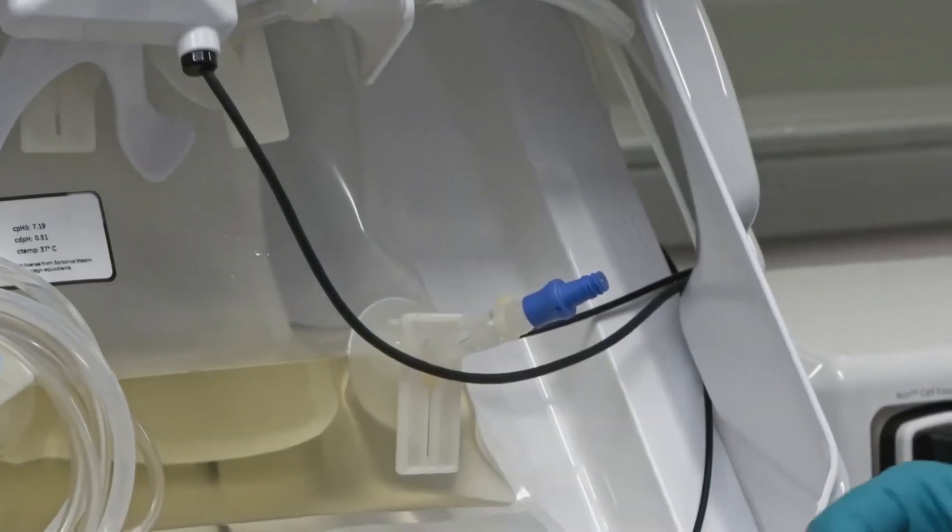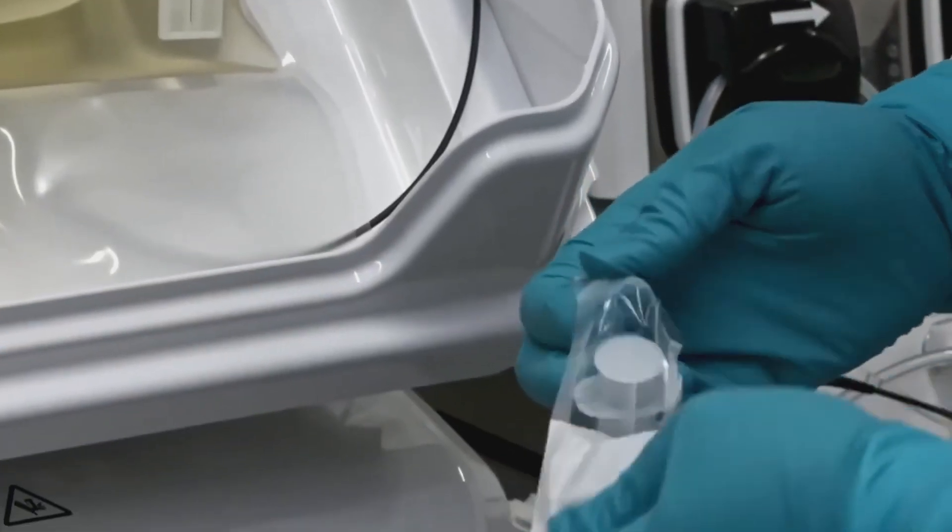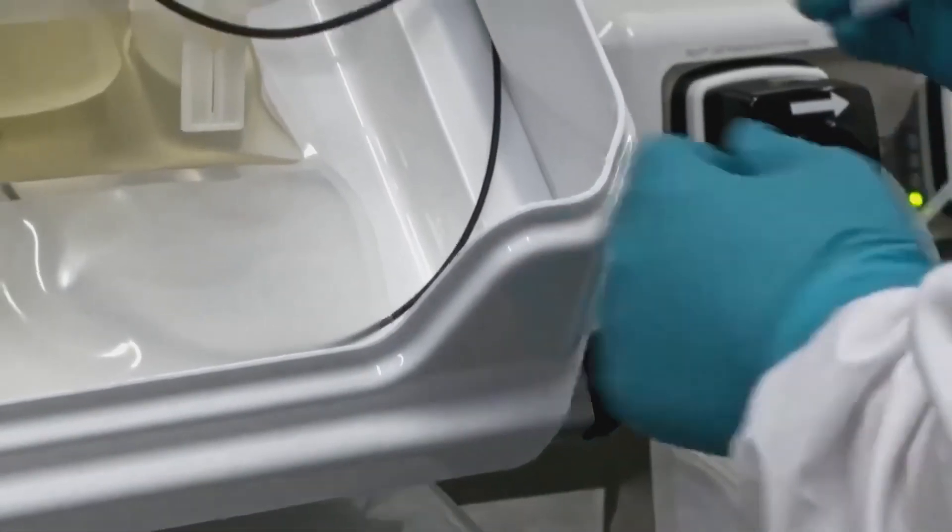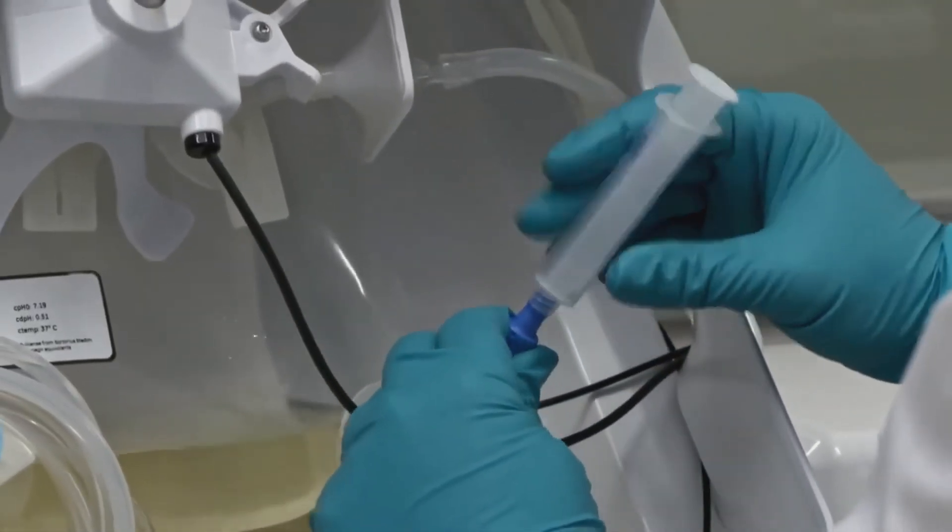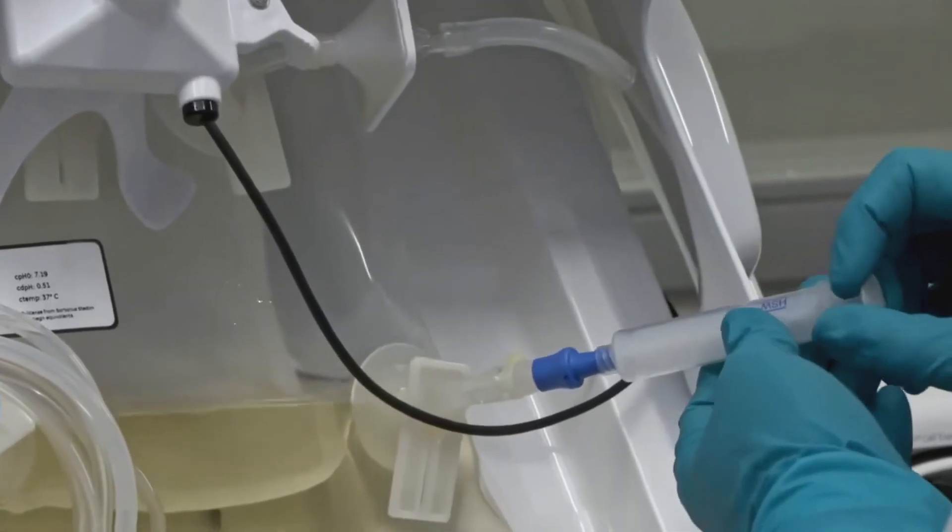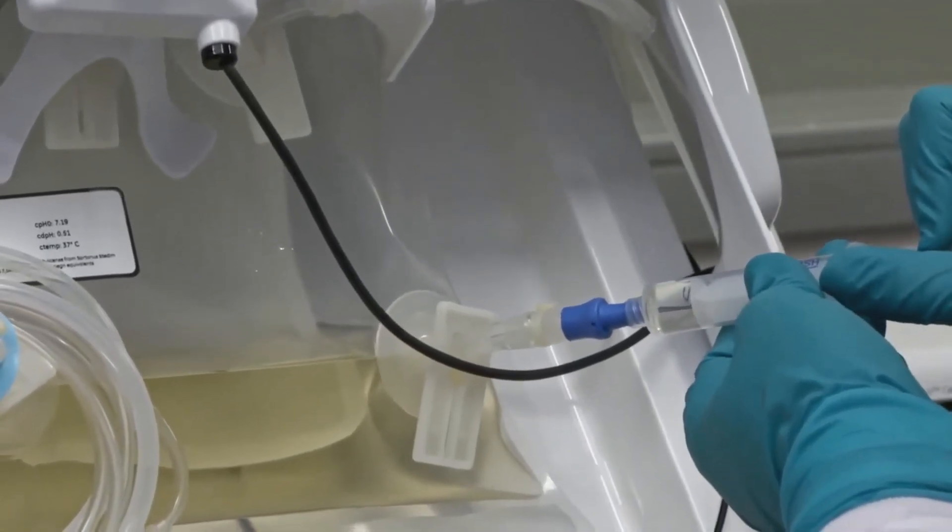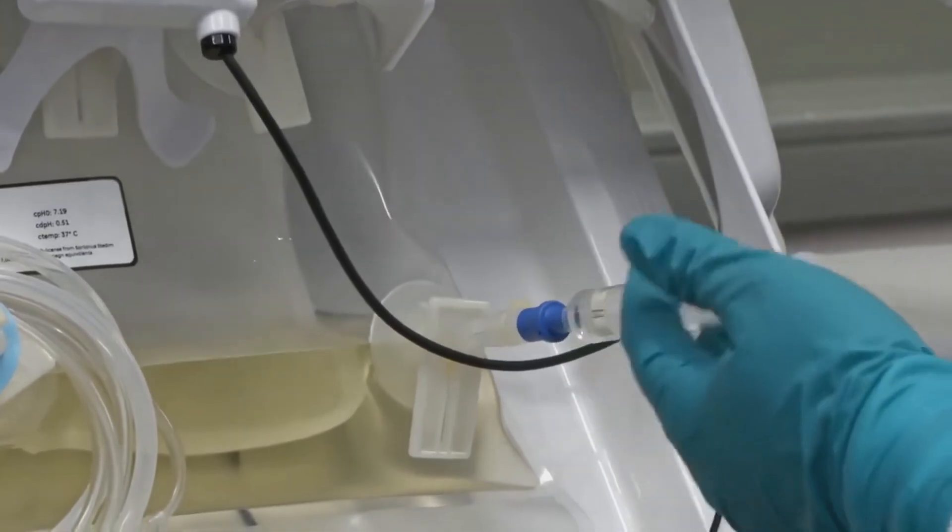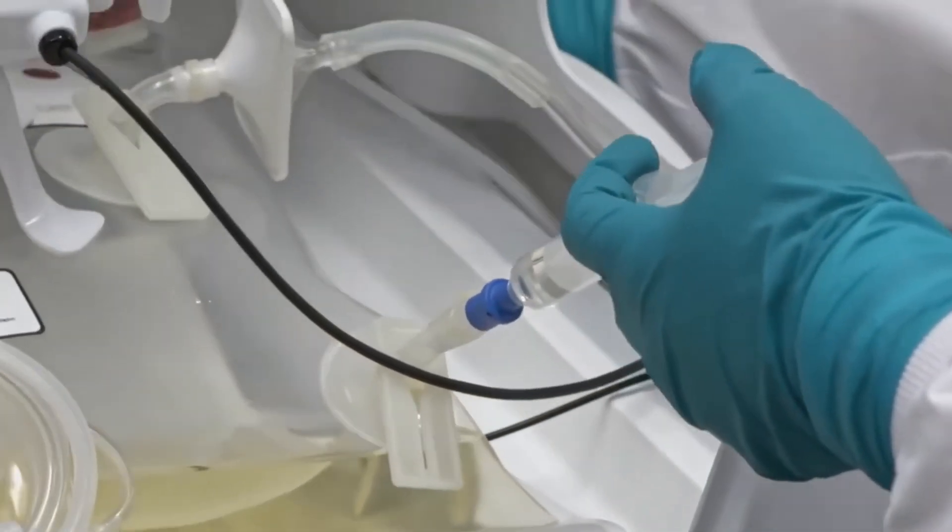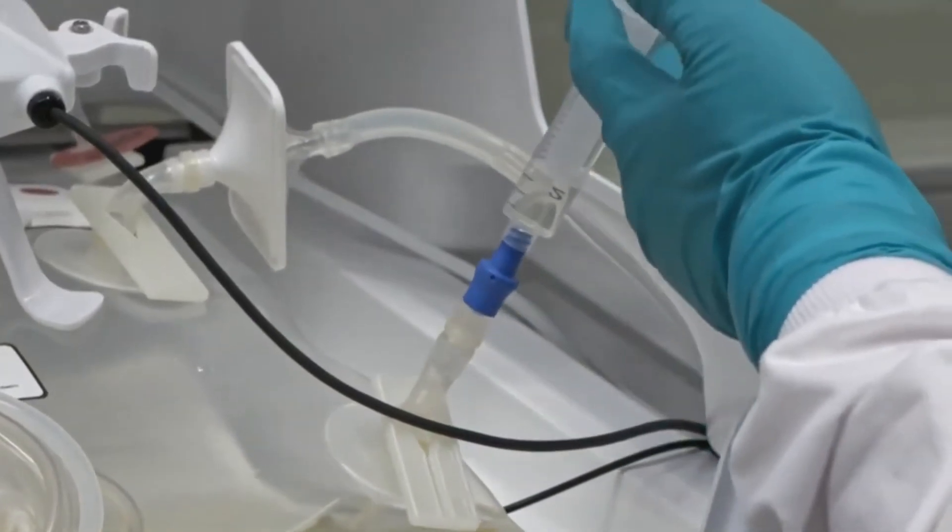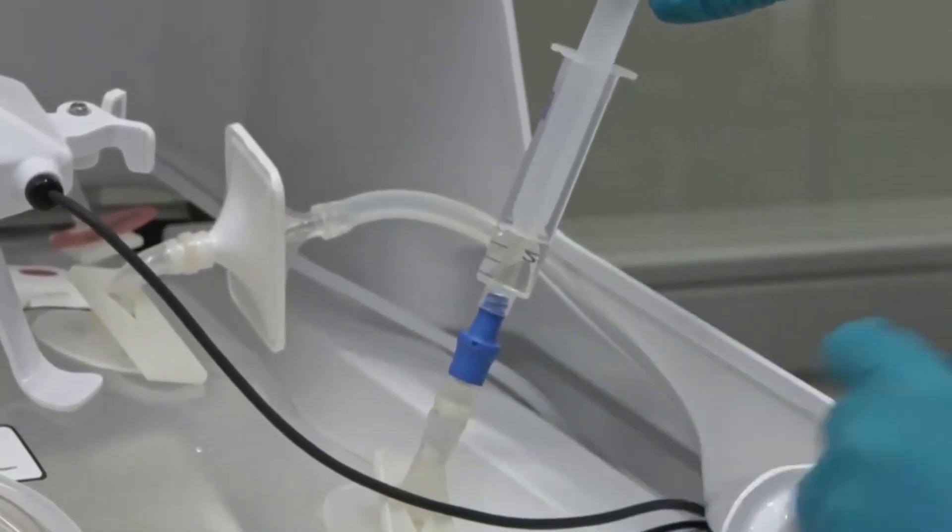You'll now unpack your syringe, connect it to the clave port and draw up the desired volume of sample. You can then tilt the tray back down and purge the line by pulling up the rest of the sample out of that silicone line.